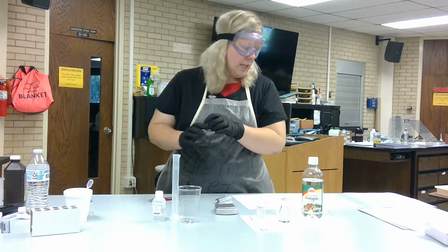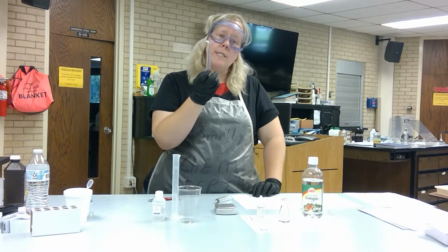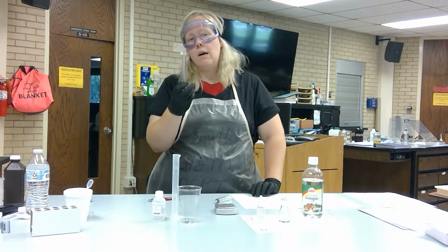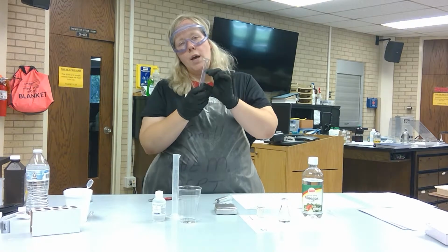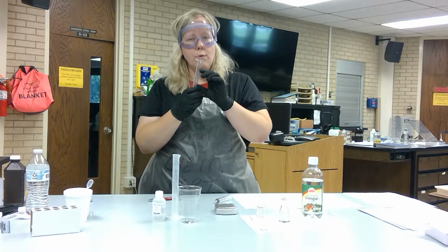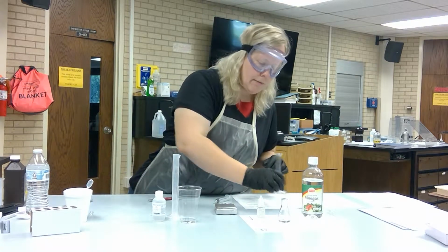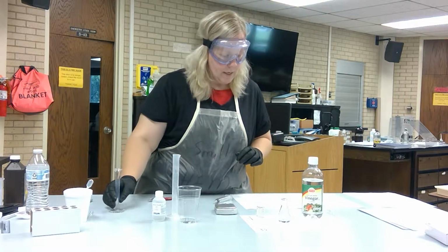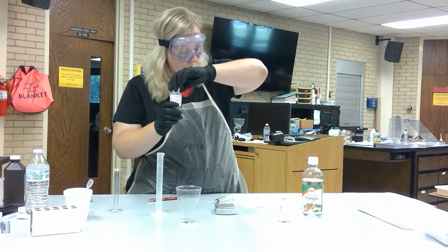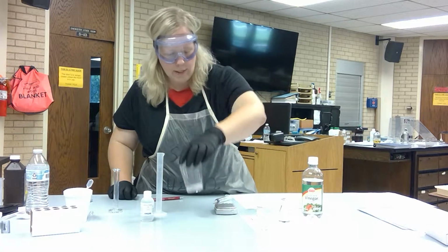Then, because you're going to need to get 10 milliliters of 1 molar sodium hydroxide, make sure that you rinse this out very, very thoroughly. I would recommend at least 3 times that you wash this, because if I put sodium hydroxide into here, that's going to change the concentration of your base. So make sure that you rinse this thoroughly with water before you actually move to measure your sodium hydroxide. All right, so you're going to need to measure out 10 milliliters of 1 molar sodium hydroxide. Once you have measured out 10 milliliters, you're going to transfer it to this cup.